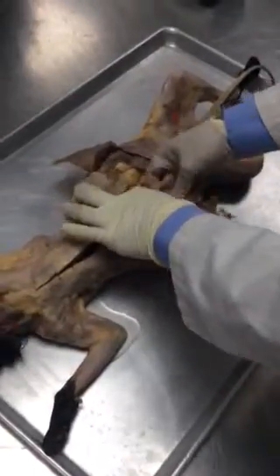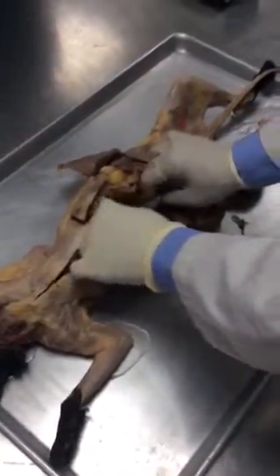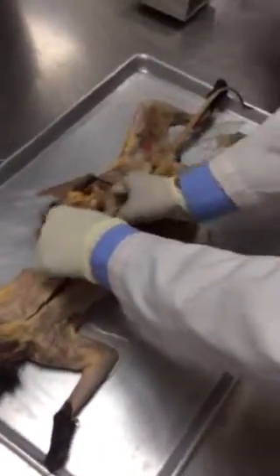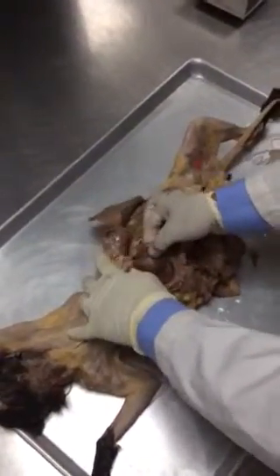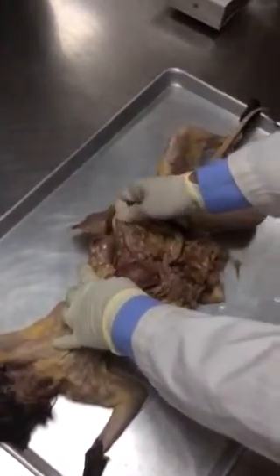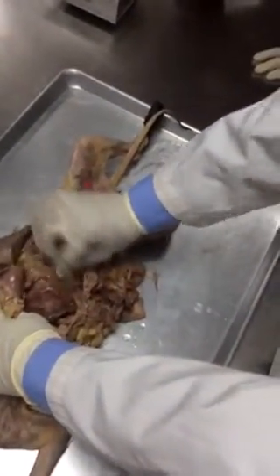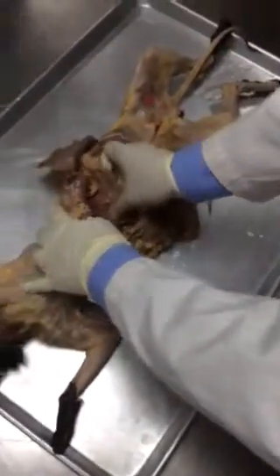Here we have got jejunum, ileum. You cannot really differentiate it, but at the upper end, you see that this is the duodenum. How do I know? Because you see the stomach right here, okay? Because this is the stomach. Can you see the stomach? This is the stomach. And you also see that the greater omentum is connected to the greater curvature of the stomach, right? I tried to draw that thing over there. This is the stomach, okay?